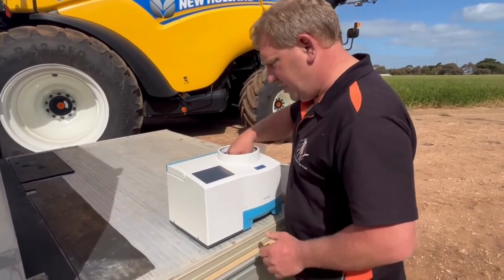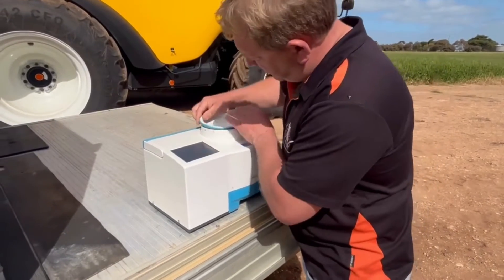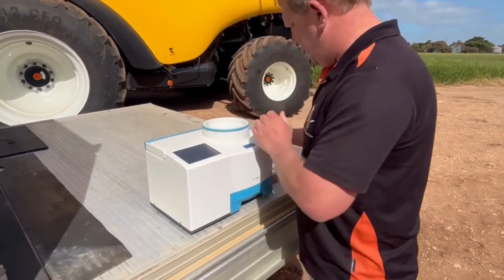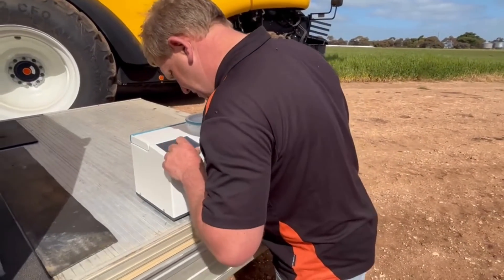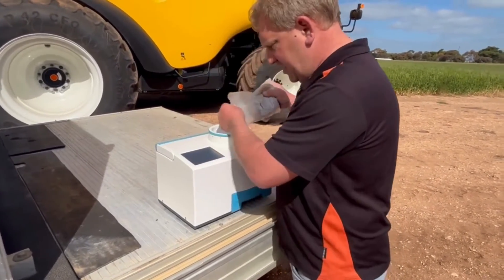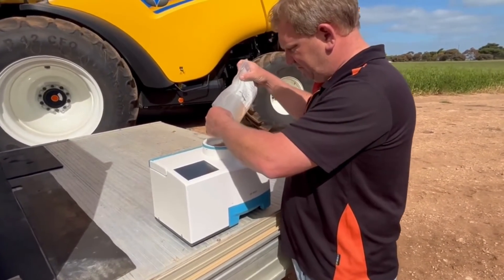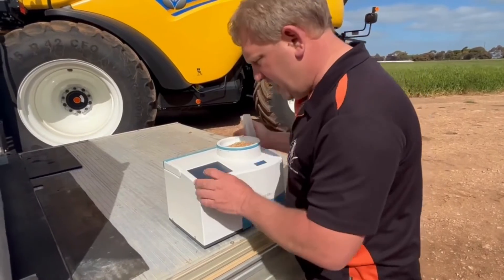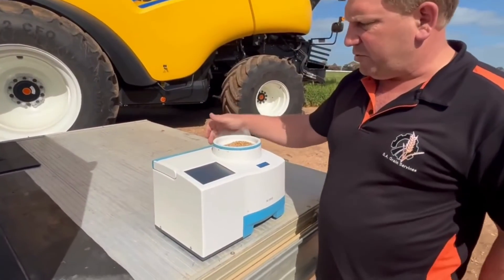Which is what we've got in there. I'm going to place that back in and close it. It's literally a 30-second job to change cells over. Then I'm going to place some wheat in here and press start, and it's just going to run through its calculations.